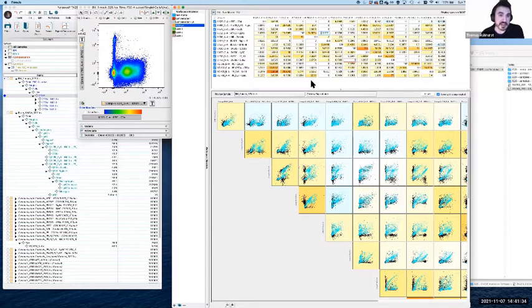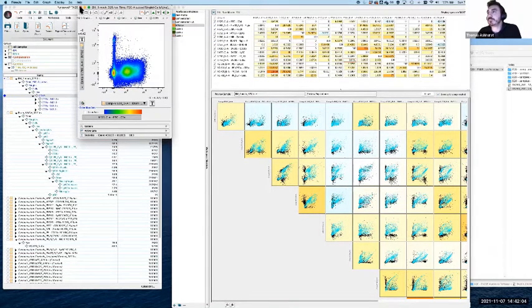Essentially, you can't have negative compensation, or you shouldn't have negative compensation. If you do, then something has become unstuck somewhere. But just to give you an idea of what happens, if we make it negative, this is going to go in the opposite direction. It's actually going to move it to the right. We shouldn't be seeing anything like that with a negative number, so keep an eye out for that as well. But I'm going to reset this to, what did I say, 0.0781. Cool, so back where we started.